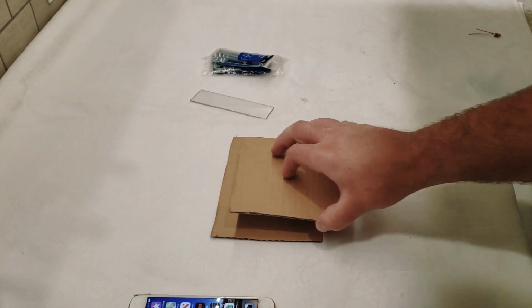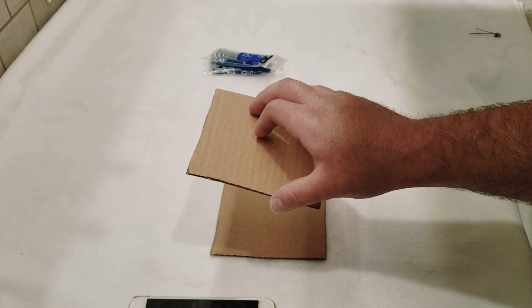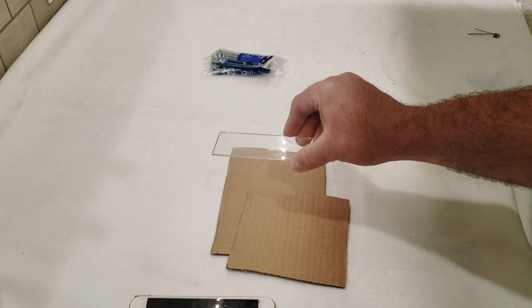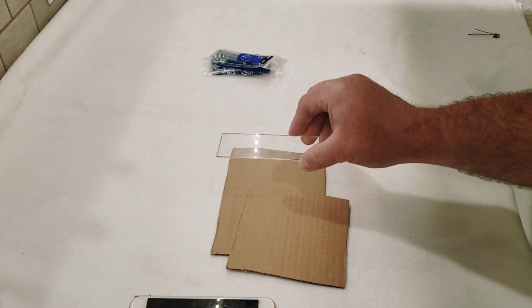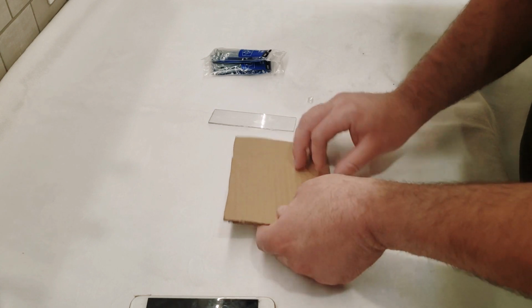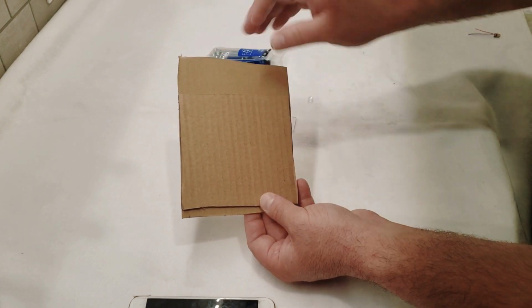So what we're going to do is we're going to make a static platform for the phone and an adjustable platform for the slides so we can kind of bring it closer or further away from the phone, just adjust it to how we need to see it. And to do that, first we are going to poke. I'm just going to line these both up, something like that. You see how one is bigger than the other?